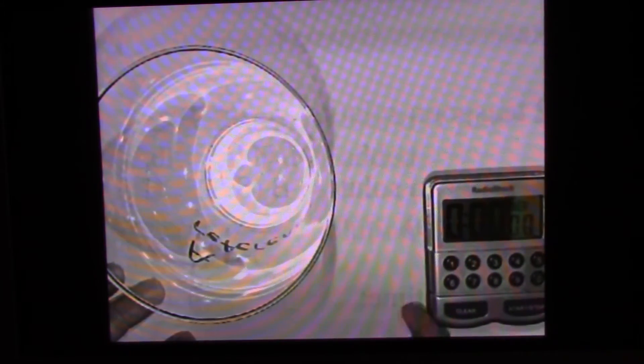There's solution A. Now we pour in solution B, hit the timer, and watch how long it takes for A and B mixed together to produce iodine. When a dark color appears, that's when we know the reaction is complete and we'll have an idea of the reference reaction rate. It took 23 seconds for the reference solution to produce the reaction.